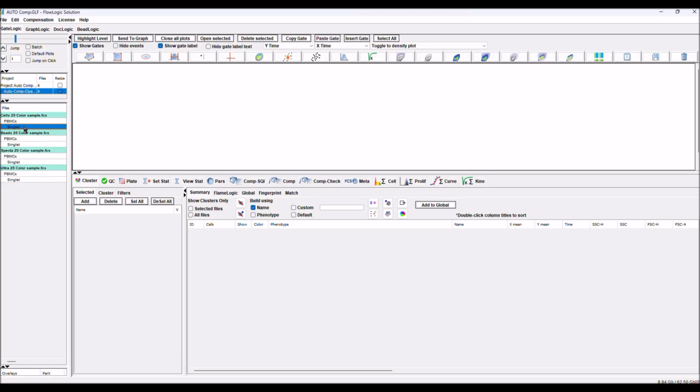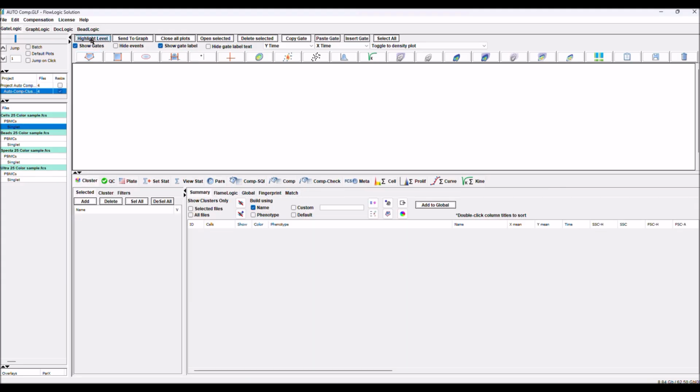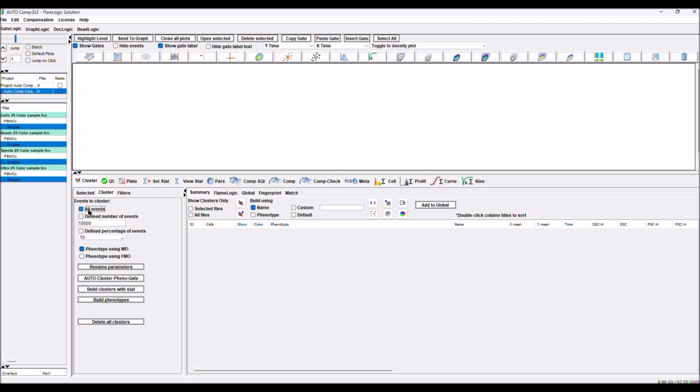So for this file, we already did the renaming of the parameters, but in case we didn't, highlight the level, we have all the singlet, add, select all, because we want to cluster for all. Clustering-Phenotyping for all. So we go to our cluster, we click all event. We can go for 10% if you just want to scan your data and do the job quite quickly, but we go for all event.